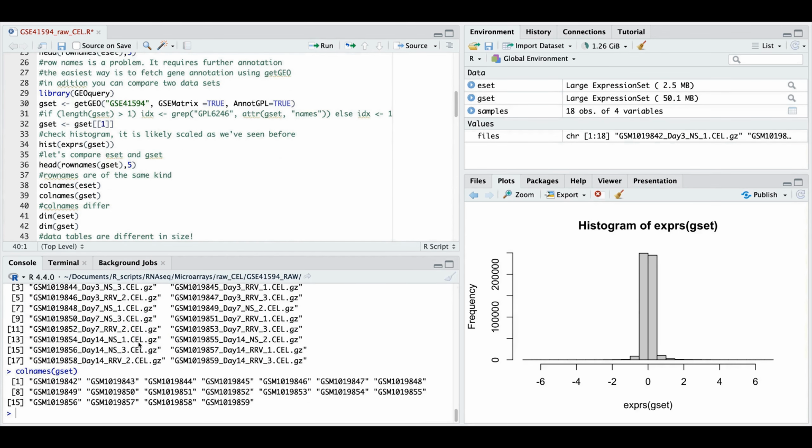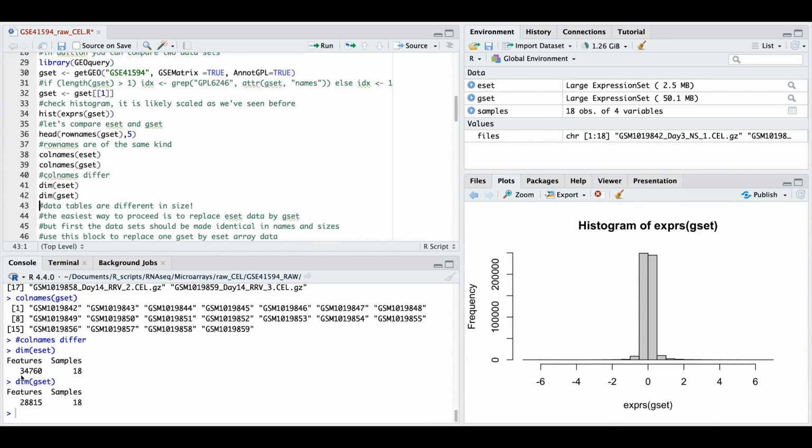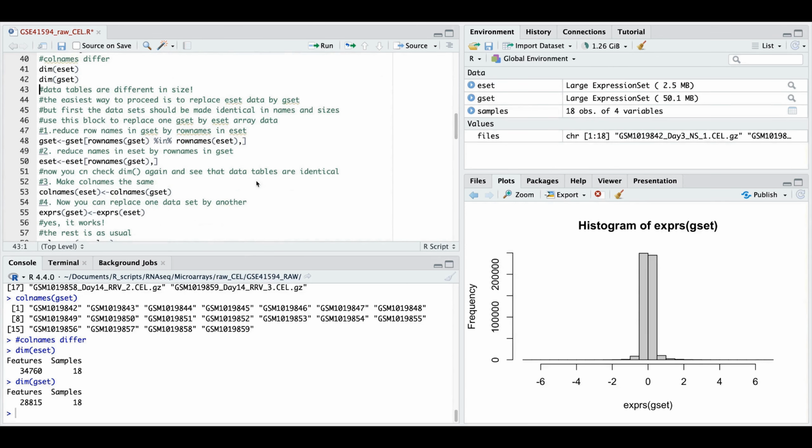Again, we have a problem. Number one, the column names are not identical, and in addition, the dimensions of the data sets are not the same. So the number of genes, which are features, differs in E set and G set, and in order to replace one by another, everything should be the same. So how to do it? We do it in 4 steps.